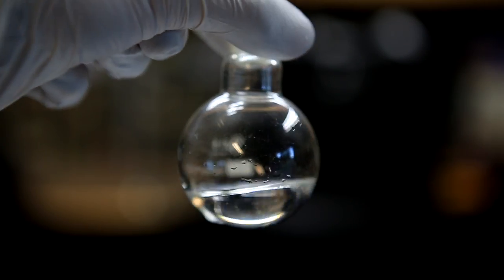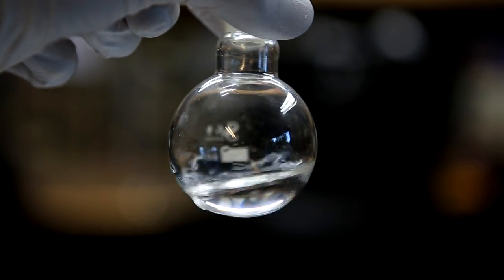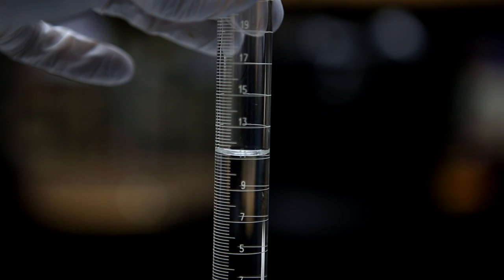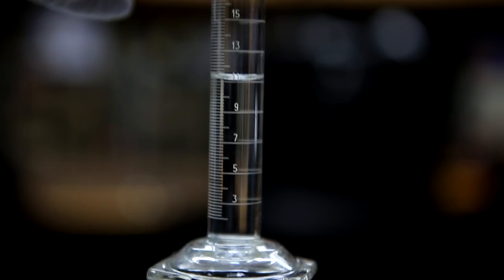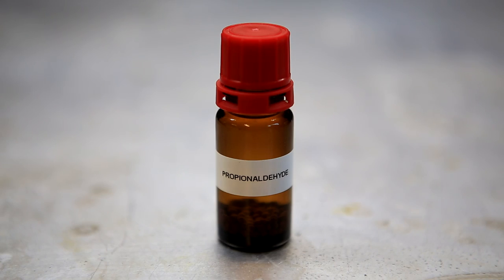At the end, I was left with a small amount of crystal clear distillate. This corresponded to a yield of about 11 milliliters. I stored this in a small amber glass vial with sieves at the bottom to keep it dry.